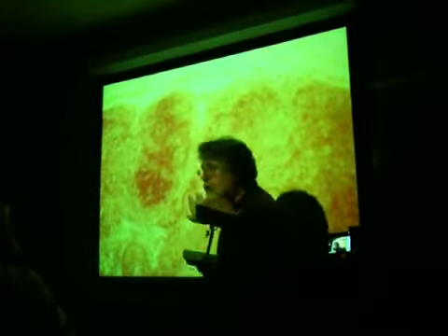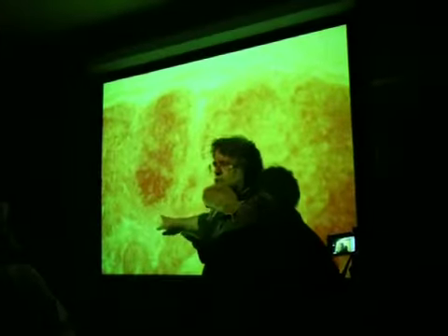What do we call this sinus right under the capsule? Subcapsular sinus. So we have the capsule way up there. Underneath it, the subcapsular sinus. Here's the trabeculae. What is this called? Lymphatic nodule. Nodule, not node. The big thing is the node.